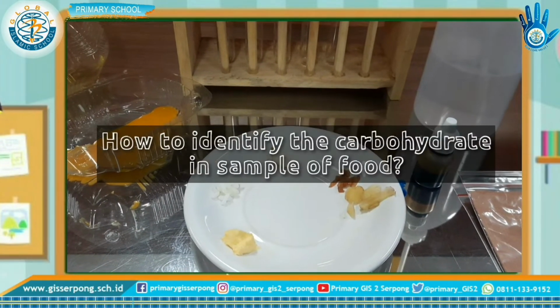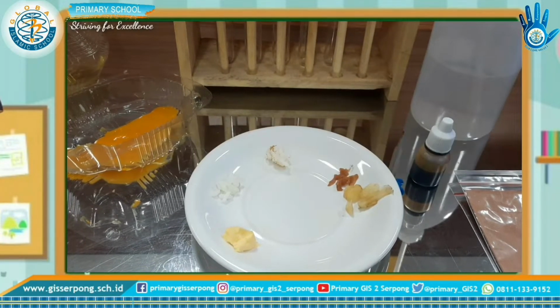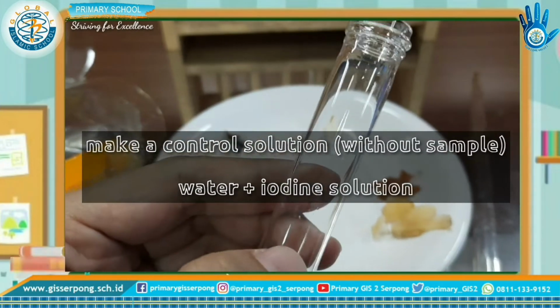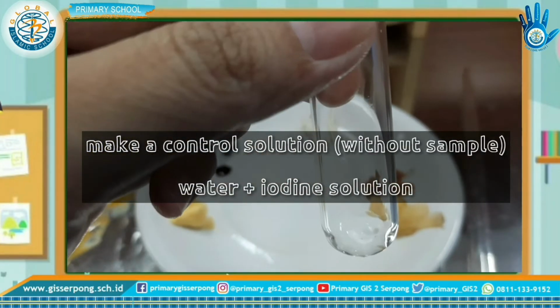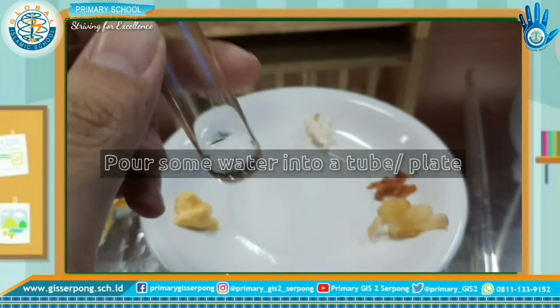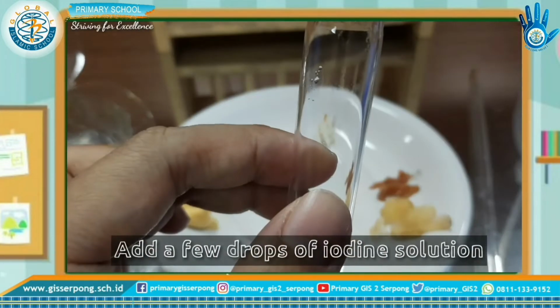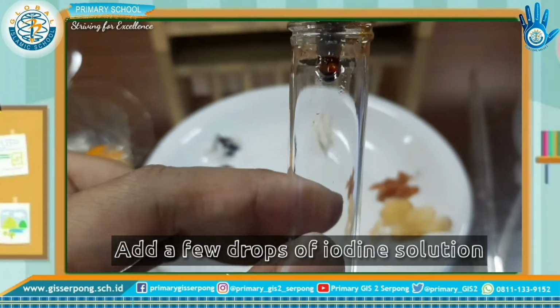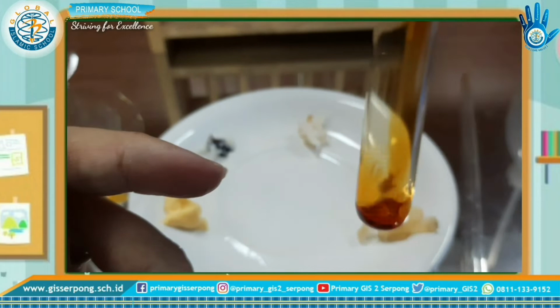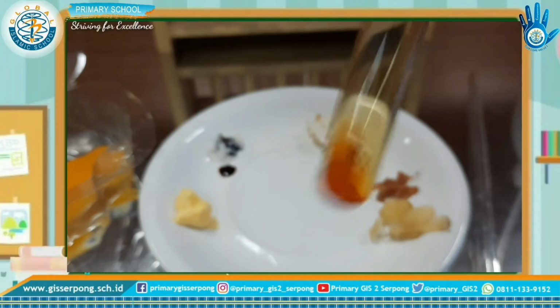How to identify the types of nutrient in food, especially carbohydrate. Let's get started. First, make a control, because we have to compare the reagent with sample and reagent without sample. This is for control. Put water into a tube and then add a few drops, just one drop. Shake it or mix it. Okay, you can see the solution become yellow to brown.